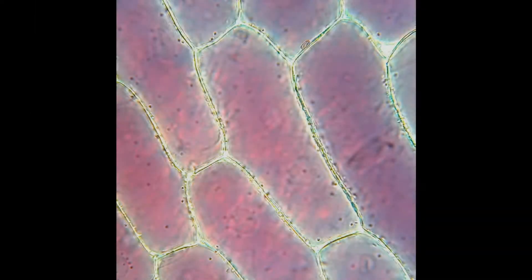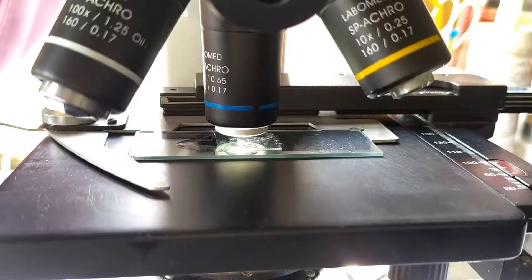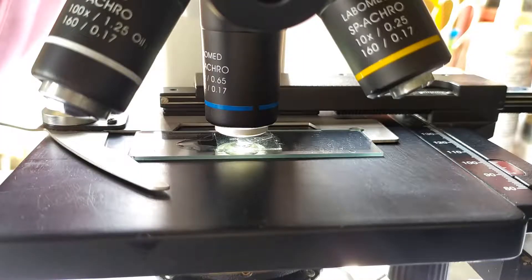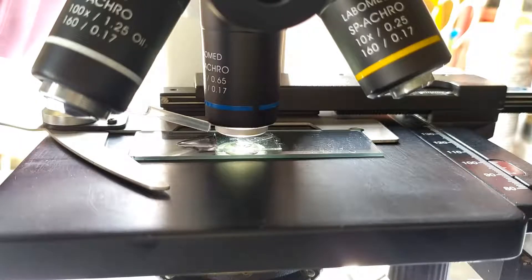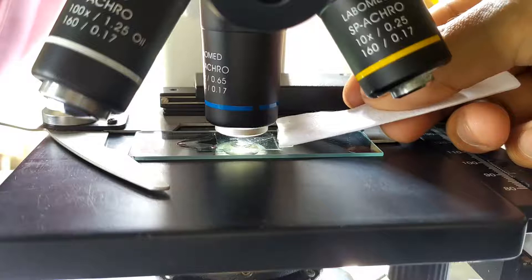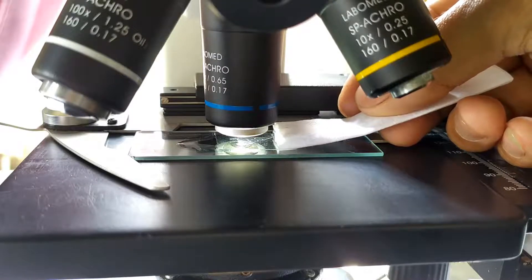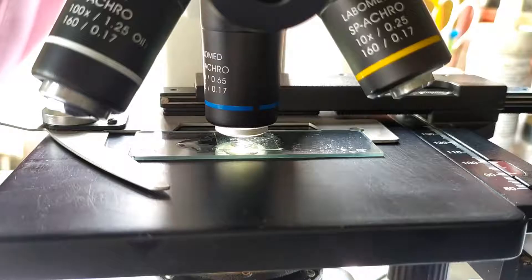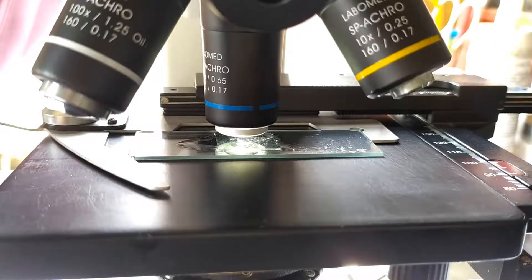Observe under the microscope and notice the normal shape of the epidermal cells in the peel. Focus on a section of the peel under high power of the microscope. Now add a drop or two of concentrated sucrose solution from one edge of the cover slip and blot the slide from the opposite edge using a filter paper strip. In this way, the sucrose solution gets sucked into the slide via capillary force, thus replacing the water originally present in the slide.